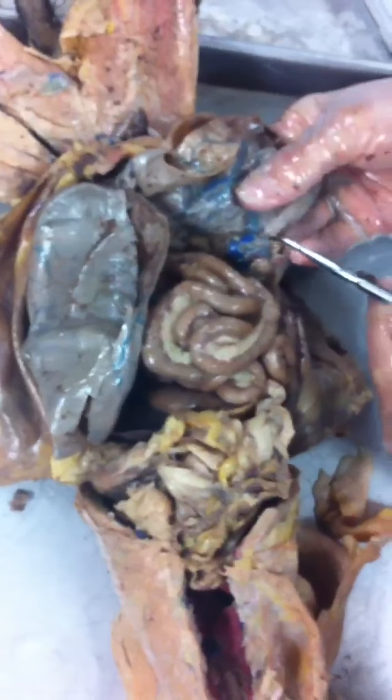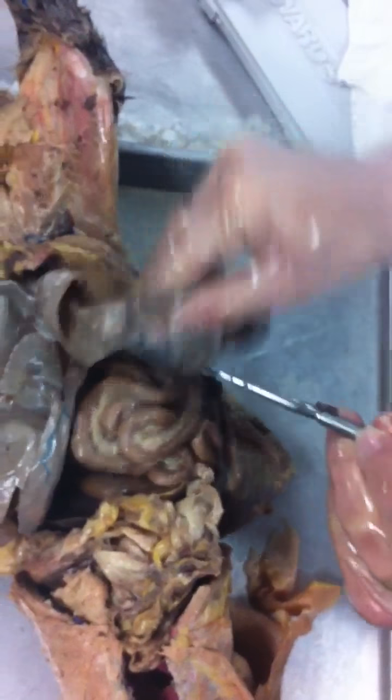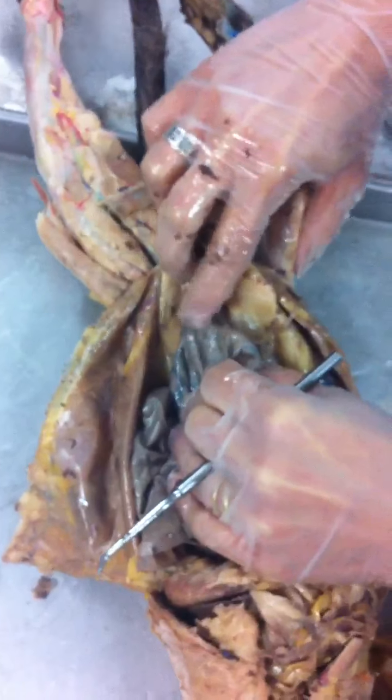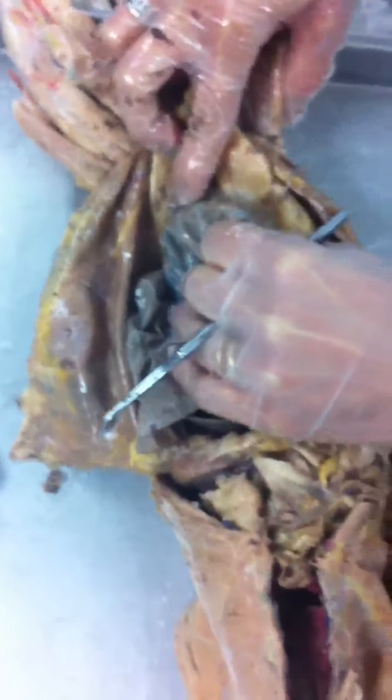You can still see that right here is the ovary, and again this surrounding tissue here is fallopian tubes and uterine horn, where they combine and come together down here. Common duct. Body of the uterus. If you were to follow the body of the uterus all the way out, what's it eventually going to become? The vagina. Thank you. Good job, Austin.